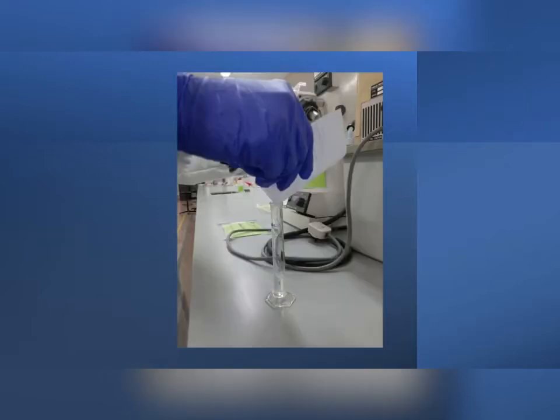Then we add 3 ml of distilled water and mix both of them, and while closing the lid with the thumb, we shake the mixture about 50 seconds vigorously, and after about 30 seconds standing still, the observation that we recorded is that foam is present inside the mixture. This indicates that the mixture is a soap.